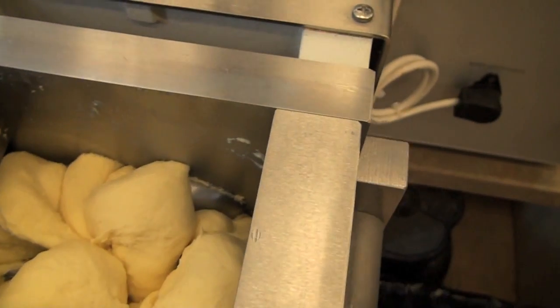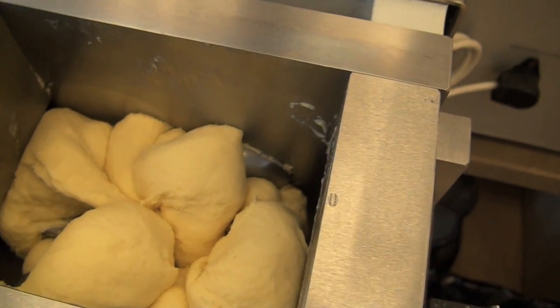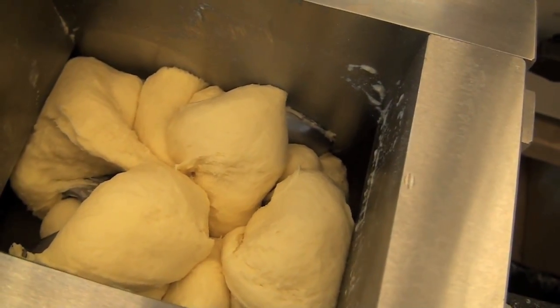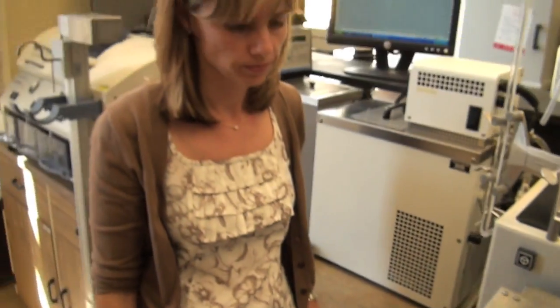The test is over and this is what's left — the mixed semolina dough. We know it's a semolina dough just because of the bright yellow color that it has, from durum wheat. Wheat dough would be more of a creamy, ivory white by comparison. Thank you very much.